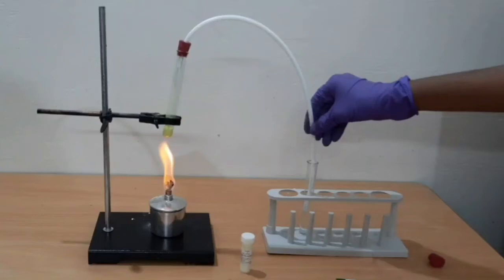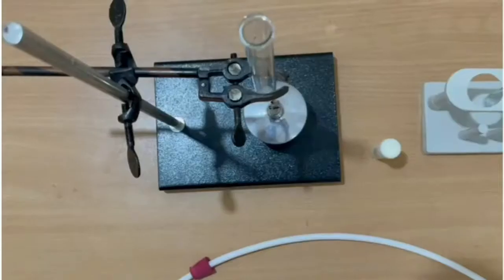Hi guys, welcome back. Today we will see an activity to show that non-metallic oxides are acidic in nature.